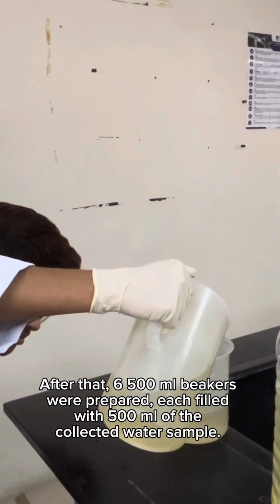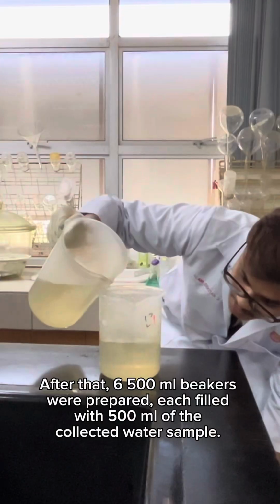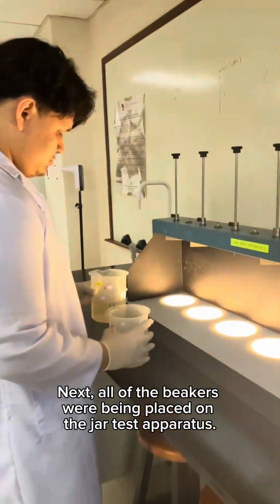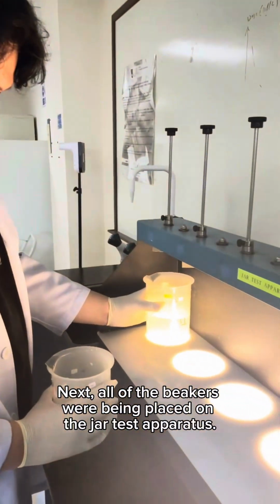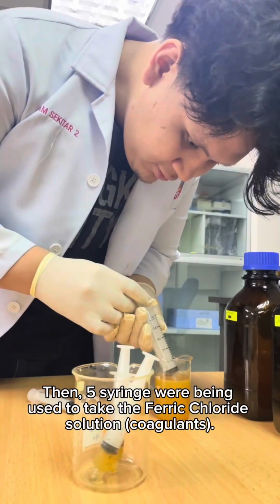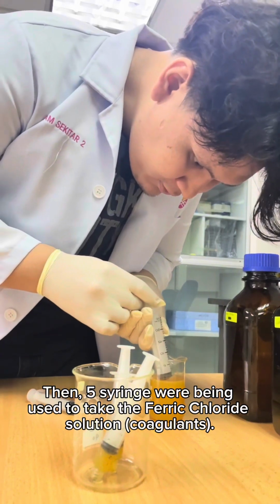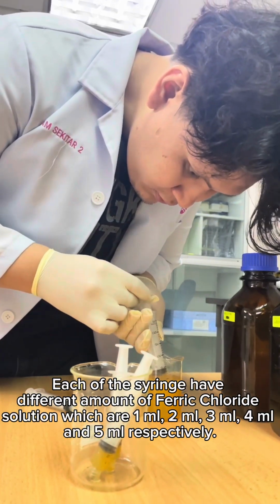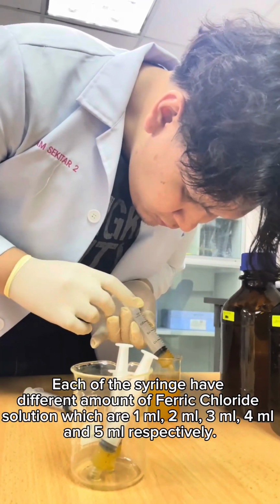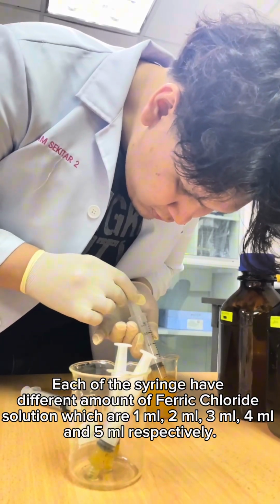After that, six 500 ml beakers were prepared, each filled with 500 ml of the collected water sample. Next, all of the beakers were placed on the jar test apparatus. Then, five syringes were used to take the ferric chloride solution. Each of the syringes has a different amount of ferric chloride solution, which are 1 ml, 2 ml, 3 ml, 4 ml, and 5 ml respectively.